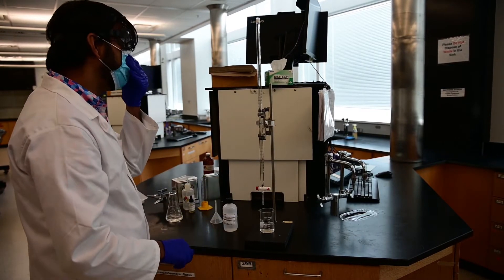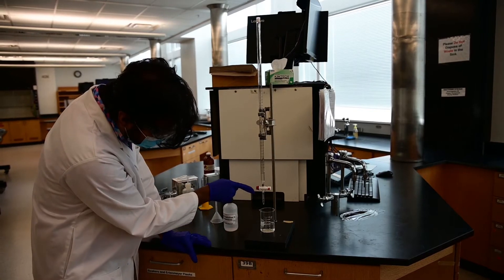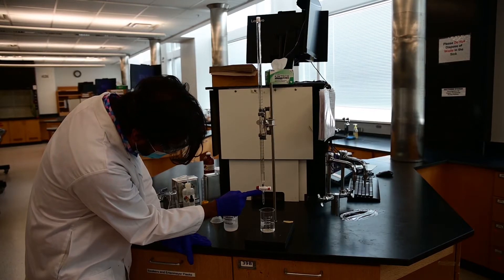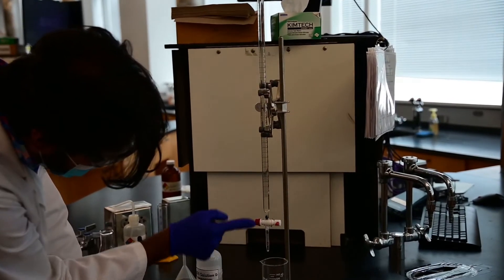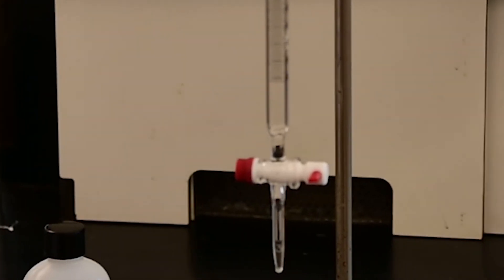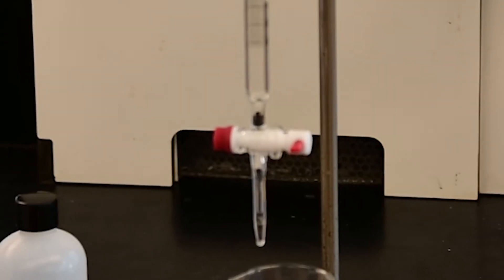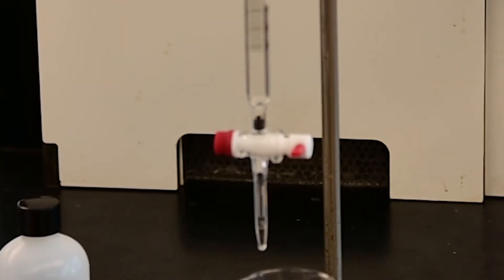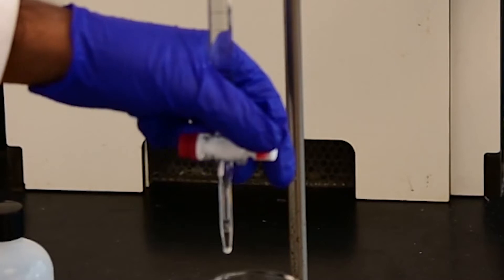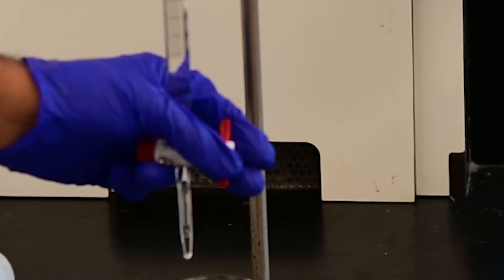So now why did we fill it up more than the zero mark? If you zoom in, you would see there is an air gap or air bubble right here. That means there is liquid here, liquid here, but there is no liquid there forming an air bubble. So we have to make sure that that air bubble is released before we start the titration. So the best way to do it is first open the tap gently with your non-dominant hand and tap on the air bubble.